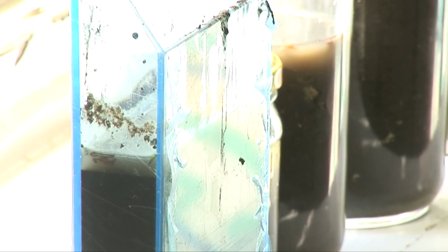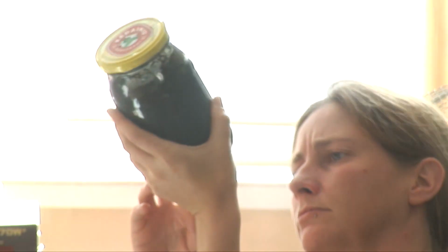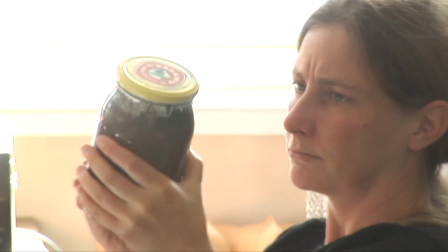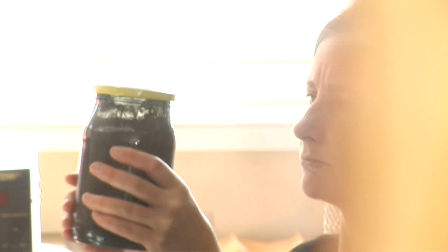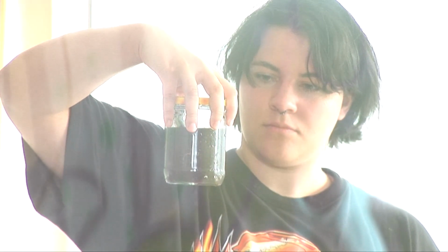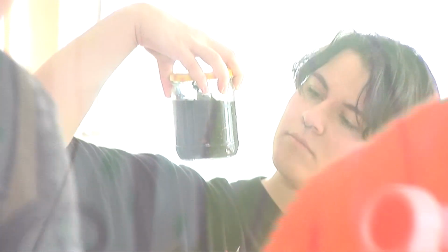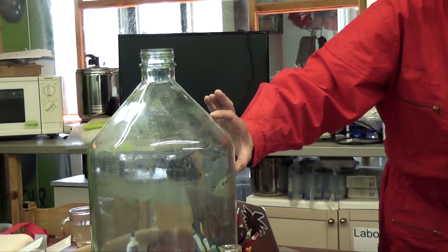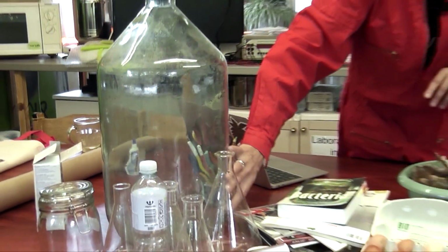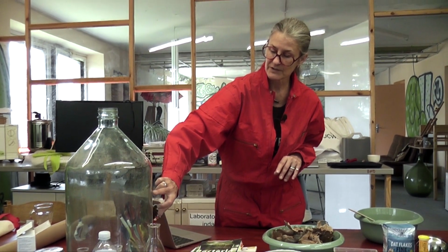Winogradsky columns involve extensive patience. So for the first few weeks for sure, but maybe even months, it might just look like a dark, gloomy, muddy miasma of nothing. You might see it separate itself out where the mud area sinks and you have a big, increasingly big band of water. And then this all might be the same kind of color. But over time, you'll begin to see different gradations of color.